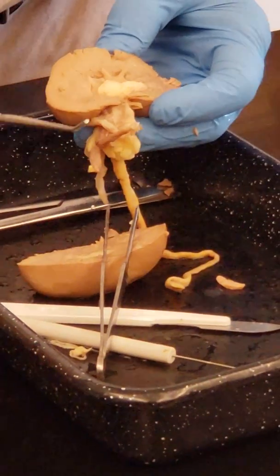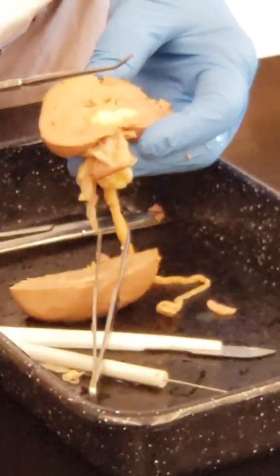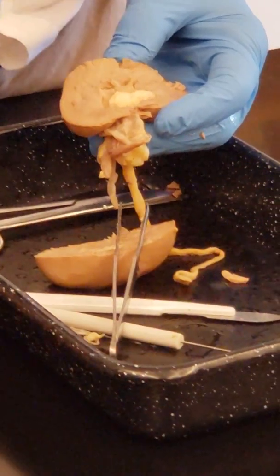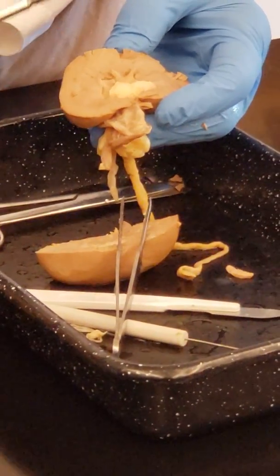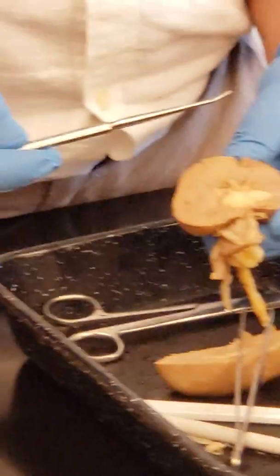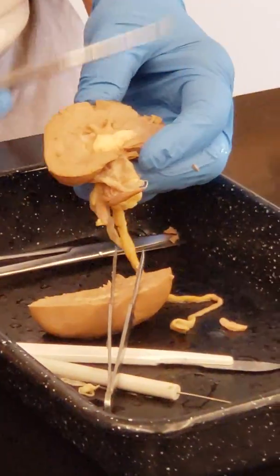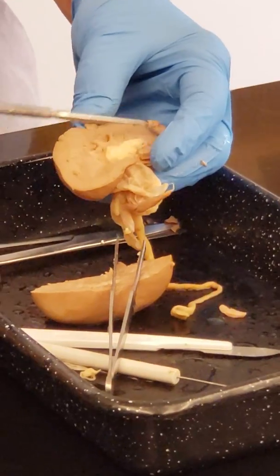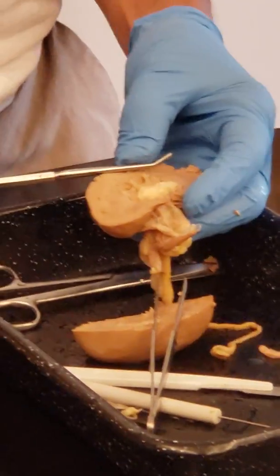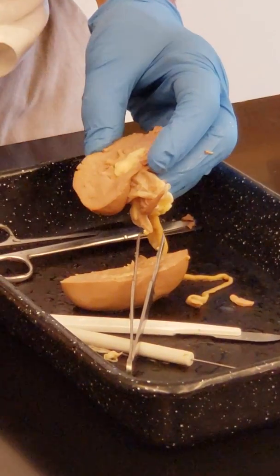Sometimes we get colored specimens. That's much better because they drain all the blood from the animal, and then they inject colored latex in the blood vessels, the arteries red, the veins blue, so you can see. So sometimes it is bicolored or tricolored, so then you can see the different structures here, but not in this one. Okay, so you don't have to dissect this. So next thing I will show you is histology.